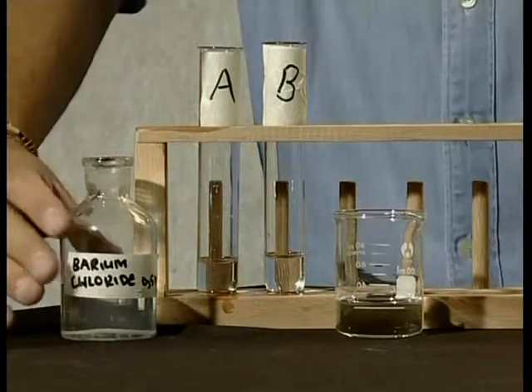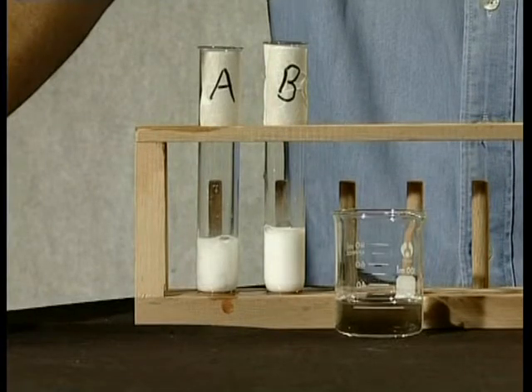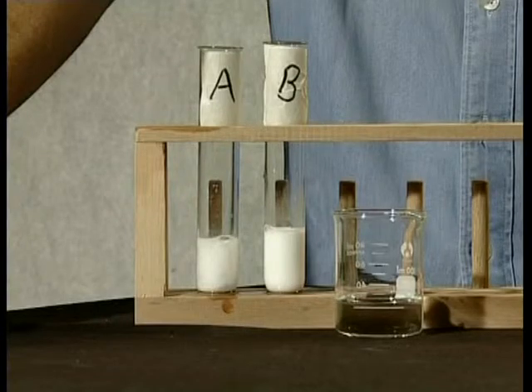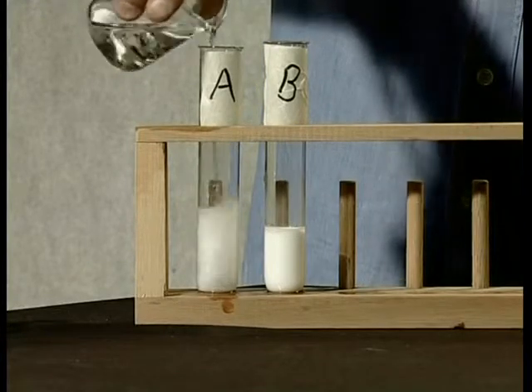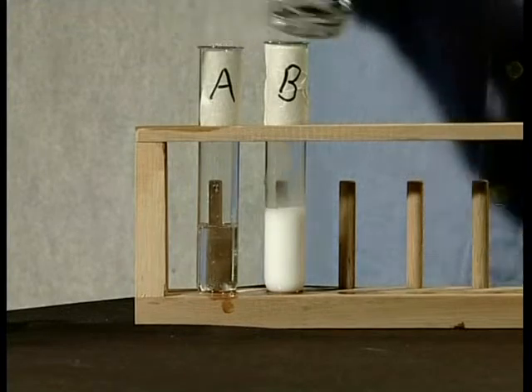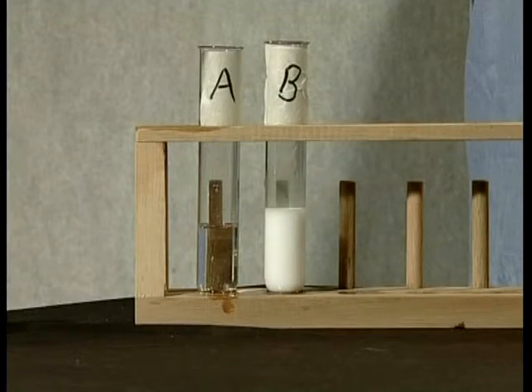Let's do the test to identify the carbonate and sulfate anions. We will do this by adding barium chloride to fresh samples of our solutions. Both test tubes show a milky white precipitate, which means that both contain either a sulfate or a carbonate. To distinguish between the carbonate and the sulfate ion we need to add a little nitric acid to each of the test tubes. The precipitate in test tube A dissolves in the acid and bubbles of gas are given off. The precipitate in test tube B is insoluble in acid. These results show that test tube A contains the carbonate ion while test tube B contains the sulfate ion.